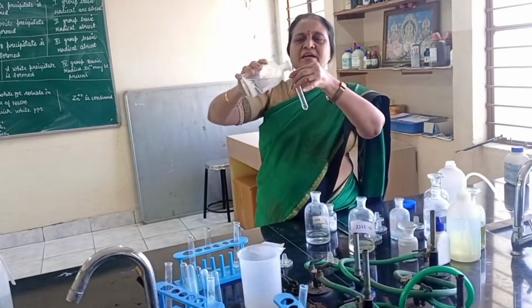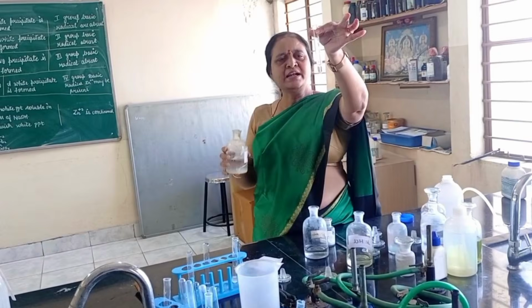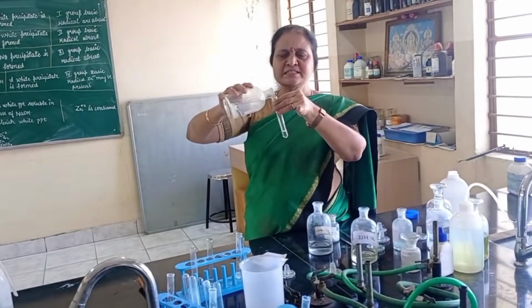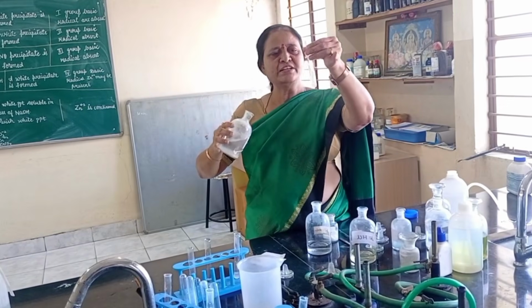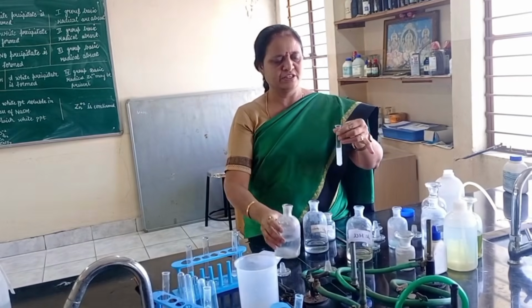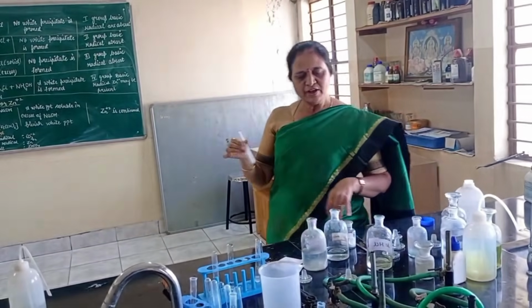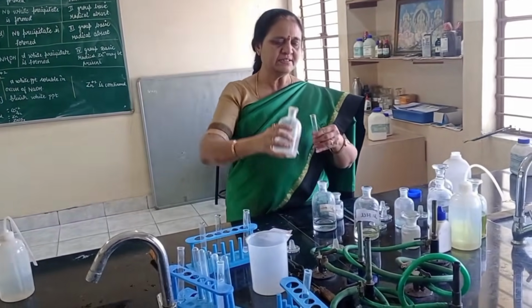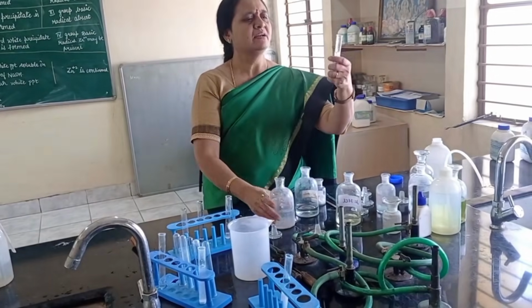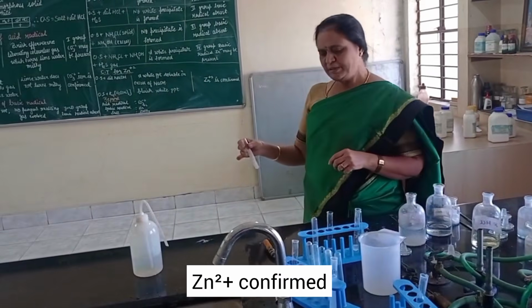If you add a small amount of NaOH, you get a precipitate. If you add excess of NaOH, the precipitate dissolves. See here, the precipitate dissolves. So this confirms that Zn2 plus is present.